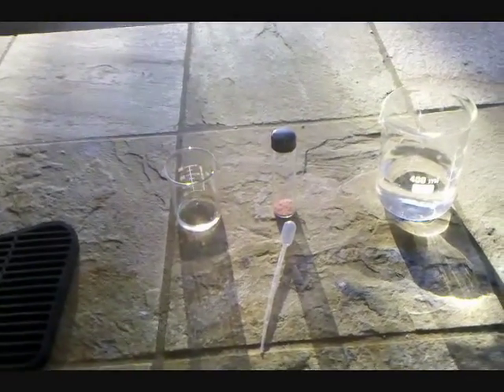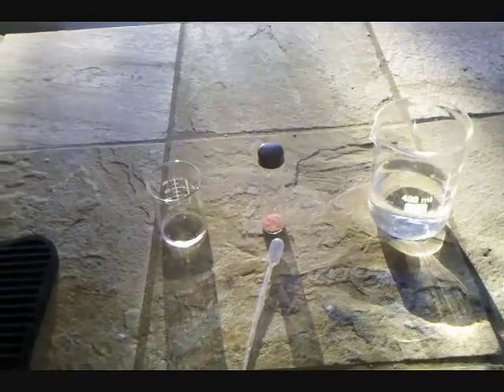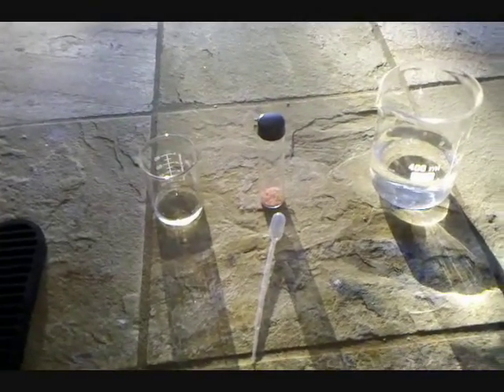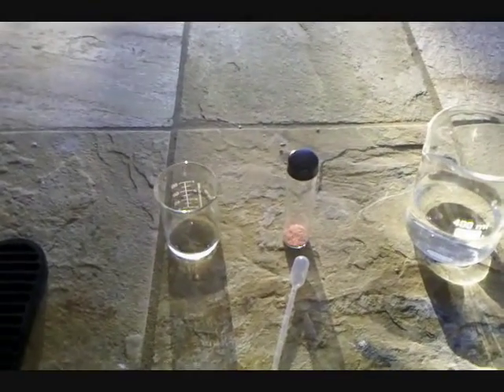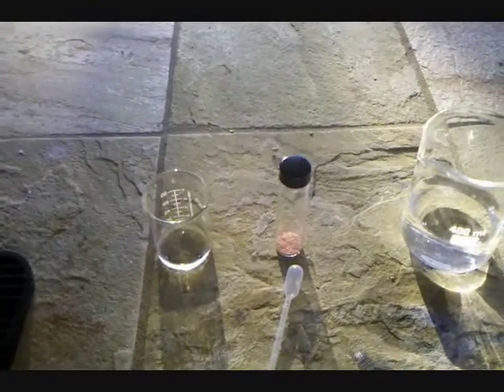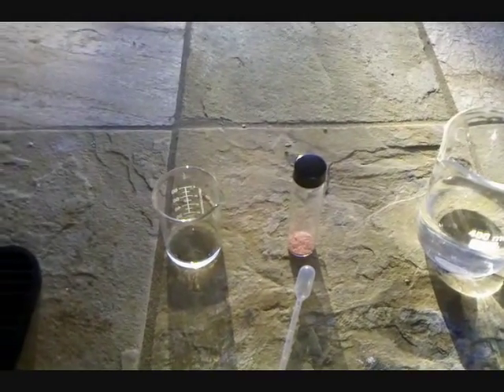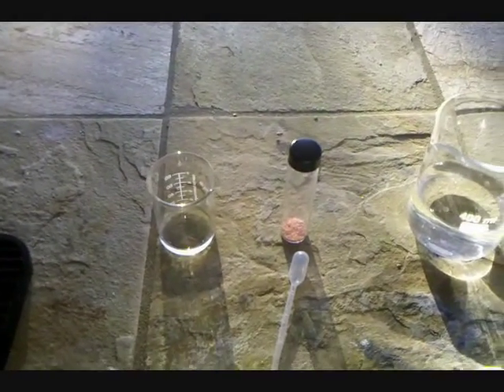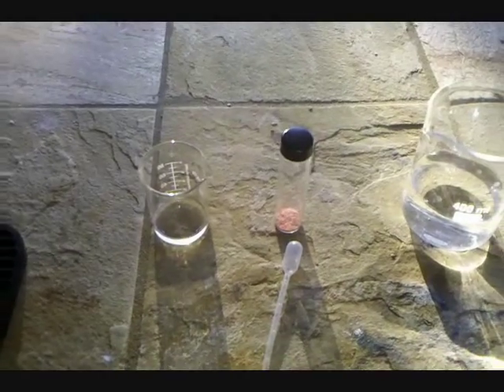Hey everyone, in this video I'm going to be showing the synthesis and some of the properties of chromyl chloride. Chromyl chloride is a compound consisting of chromium, oxygen, and chlorine, with the formula CrO2Cl2.